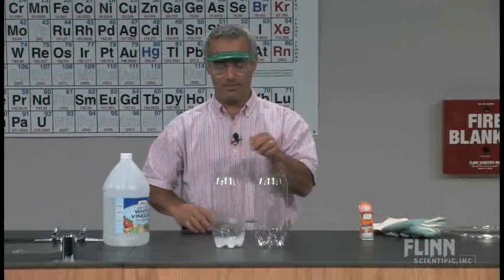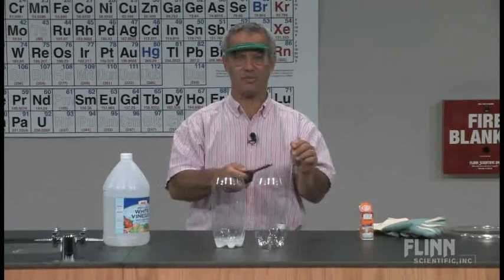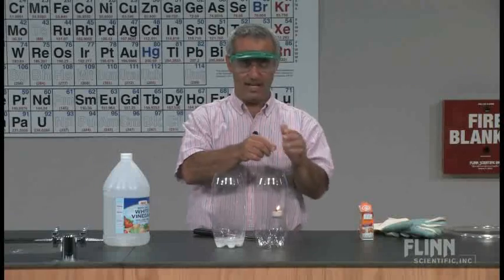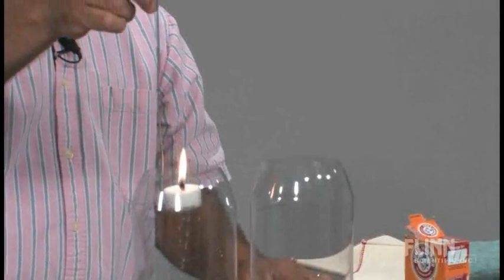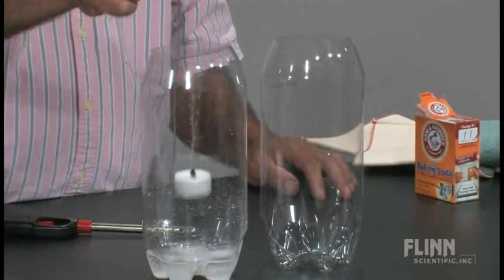So was I successful just now at pouring the carbon dioxide from there into there? It looks like I spilled a little bit there. Couldn't really see it. Well here's the proof we want, right? We saw the carbon dioxide was in there and now it's not. Actually got a little bit at the bottom still.